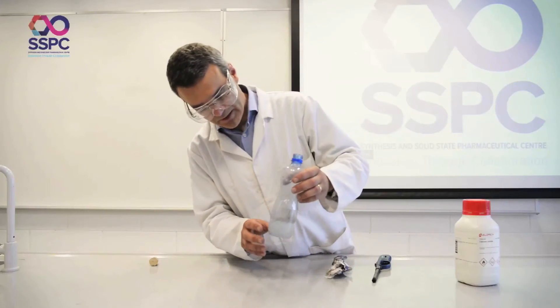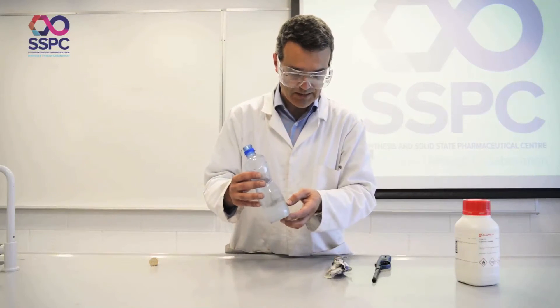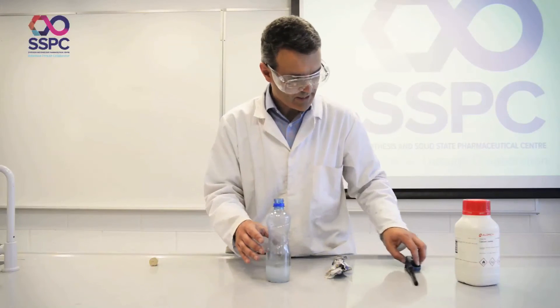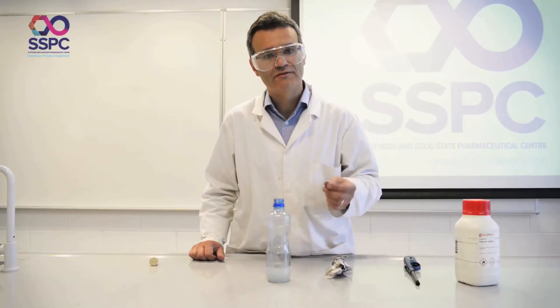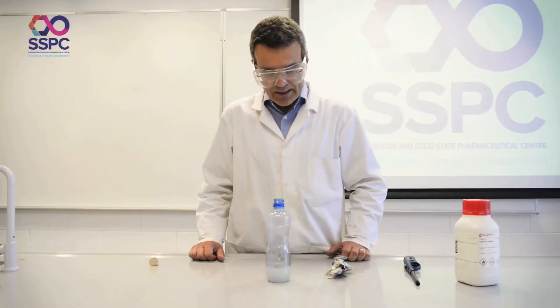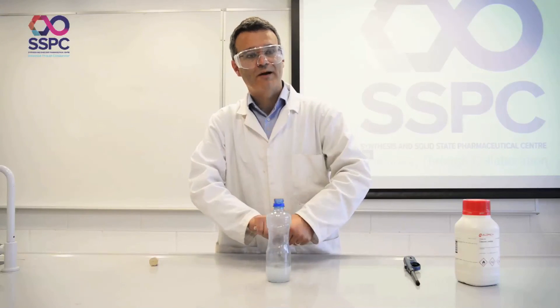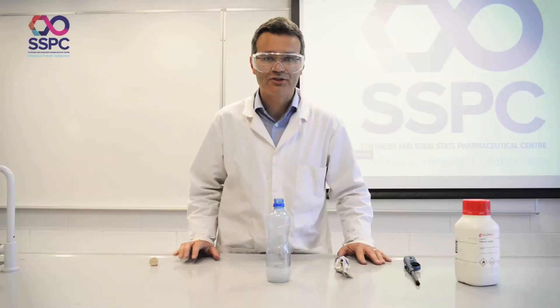It's still bubbling away here. You can dispose of it — it's an aqueous alkaline solution at this stage and you can just flush it away. Safety points: certainly just one or two little chips of calcium carbide. The paper — nice and tight fit; the tighter the fit, the bigger the bang. That's pretty much it. Thank you.